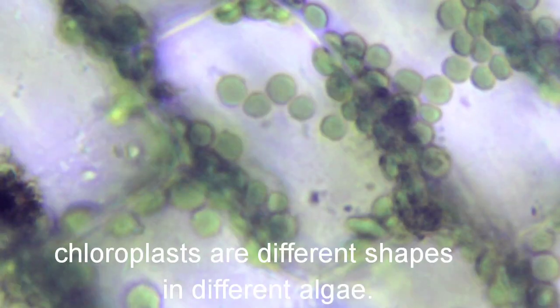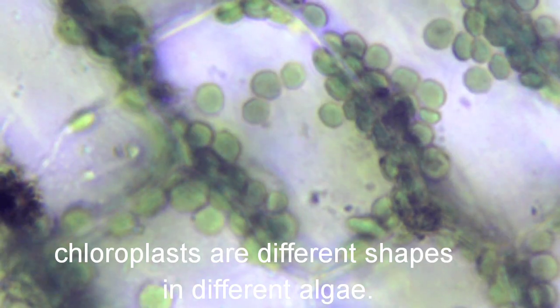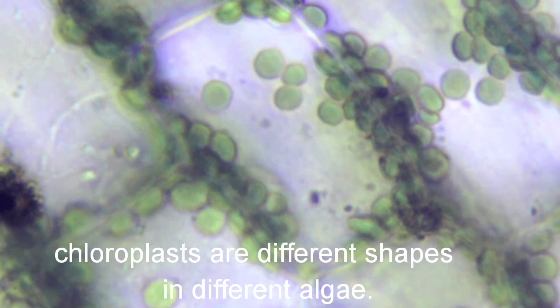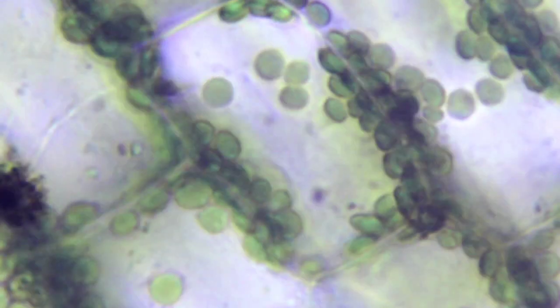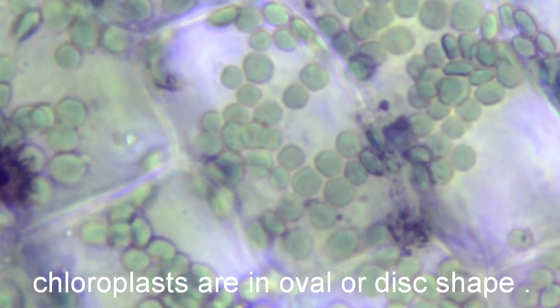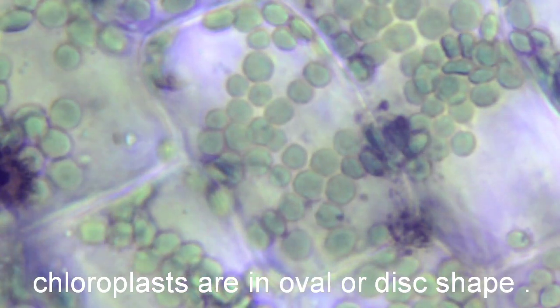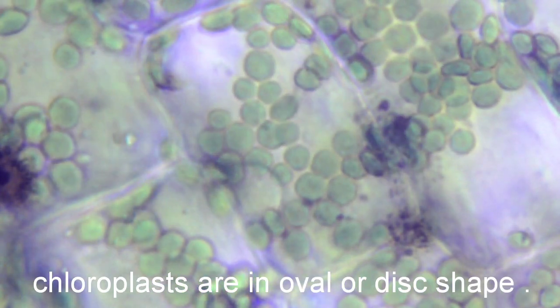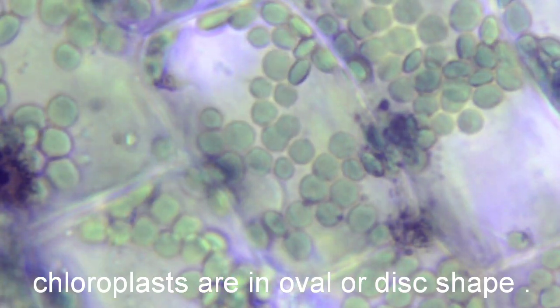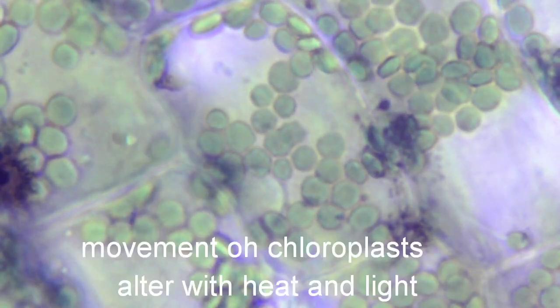Chloroplasts are of different shapes in different algae. What is the shape of chloroplasts in hydrilla? These chloroplasts are oval or disc-shaped, and they move around the cell.